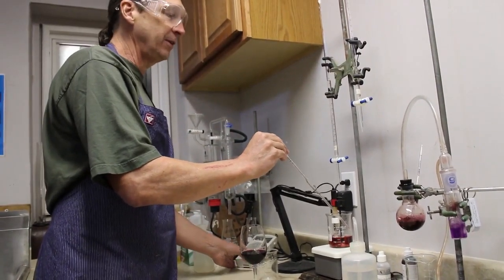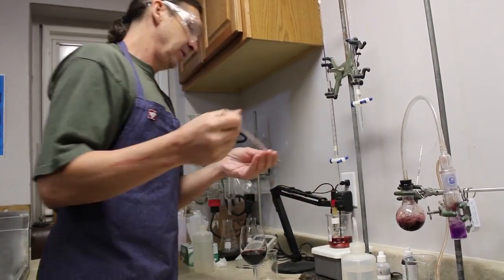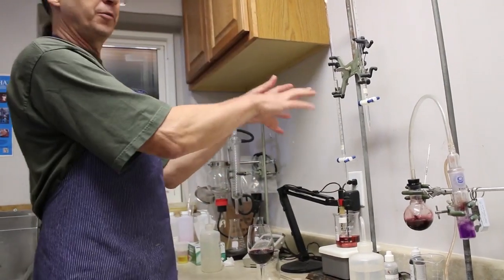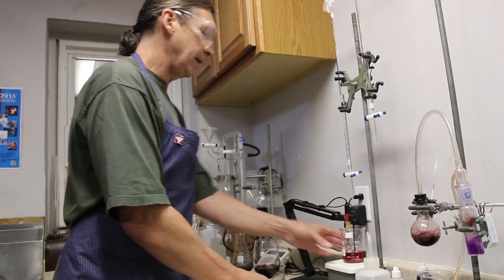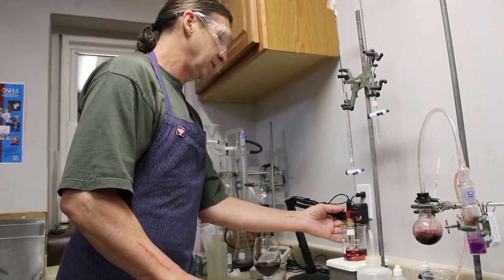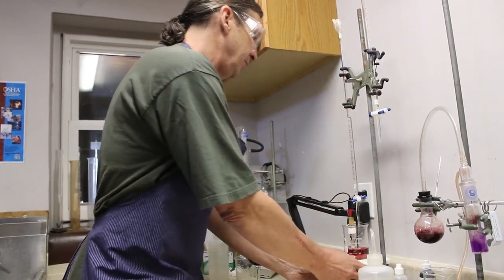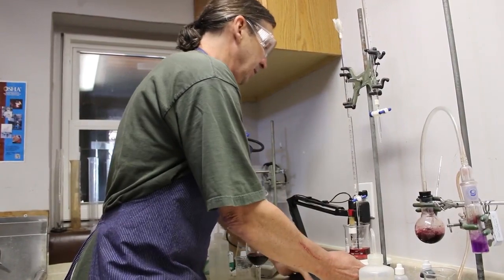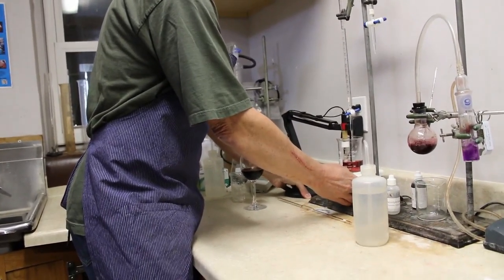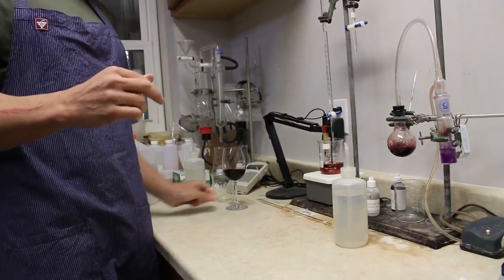That's exactly what the phenolphthalein does. So I just want to know at what point the sodium hydroxide neutralizes the acid, and then I can determine how much was in this to begin with. I'm trying to find an endpoint of 8.2 pH, because that has been identified as the right pH endpoint to look at the neutralizing of the acidity.